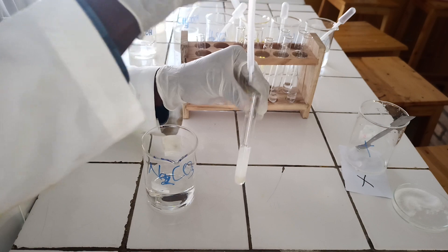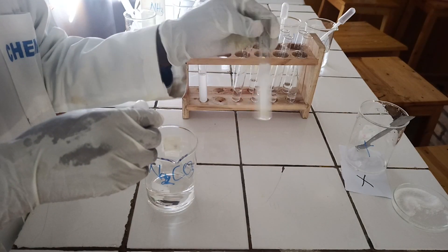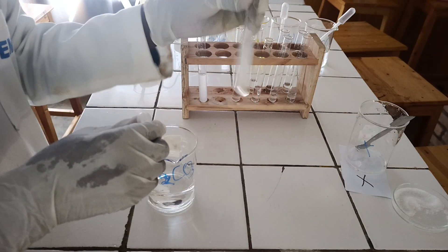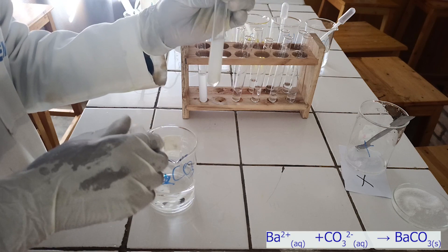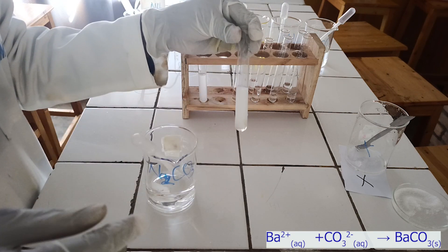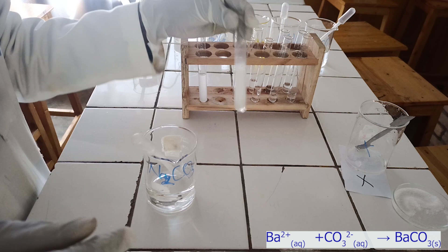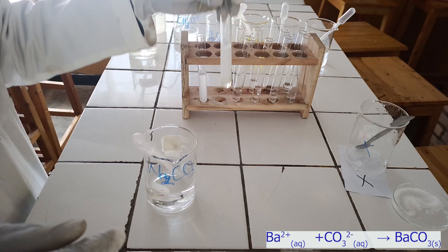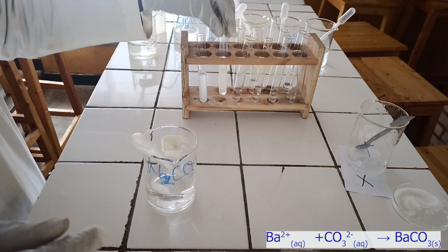As you see, sodium carbonate reacts with barium ion to form a white precipitate, which is insoluble in excess sodium carbonate. Below, there is the ionic equation for this reaction.